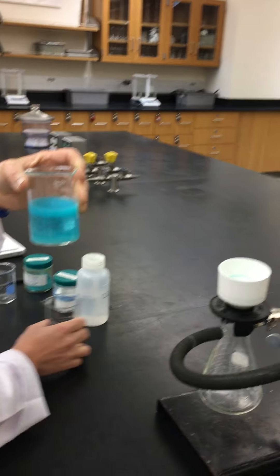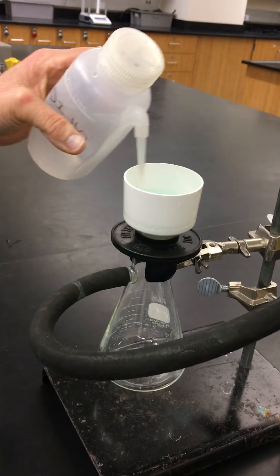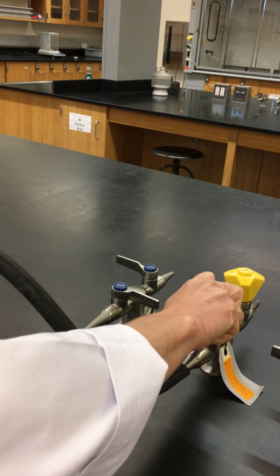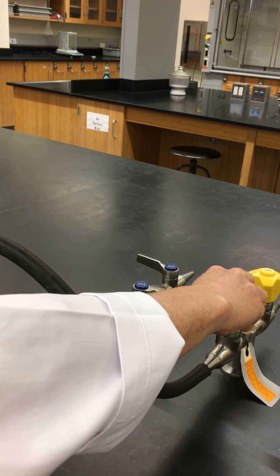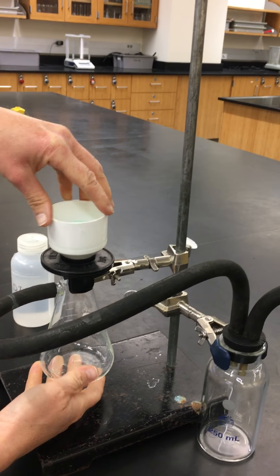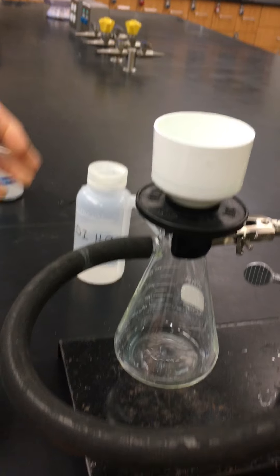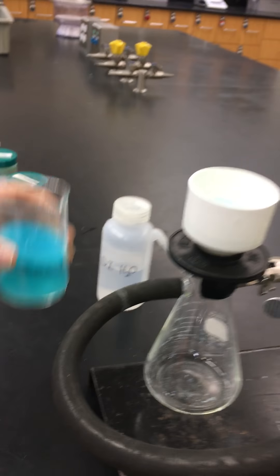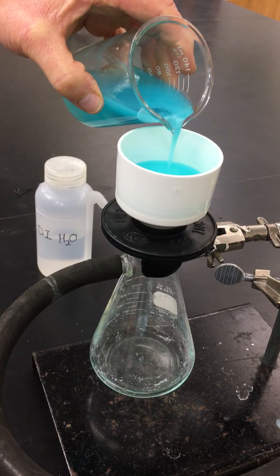Over here we have our vacuum filtration apparatus set up. The first thing we always want to do before filtering is wet the filter paper. Now we're ready to turn on the vacuum. We always want to slowly turn it on so we don't accidentally rupture our filter paper. When we see a nice vacuum, you can see the water is pulled through immediately. Now we're going to add the copper phosphate to the filter paper.